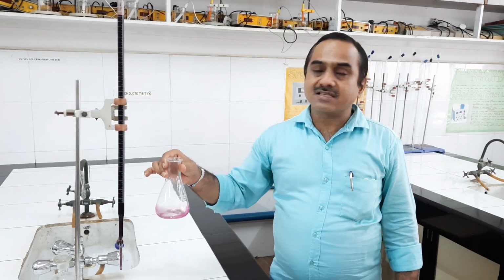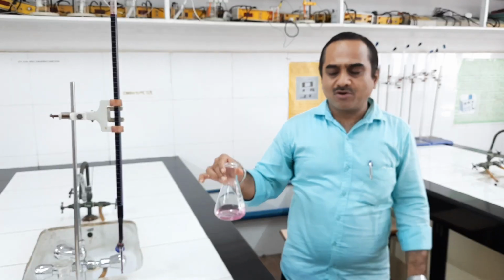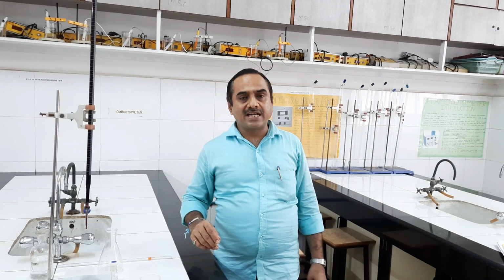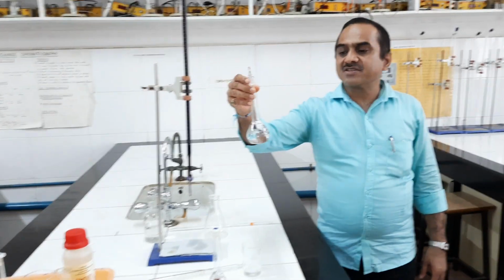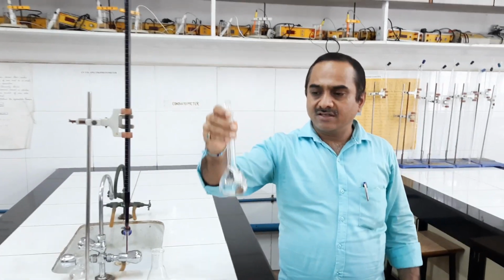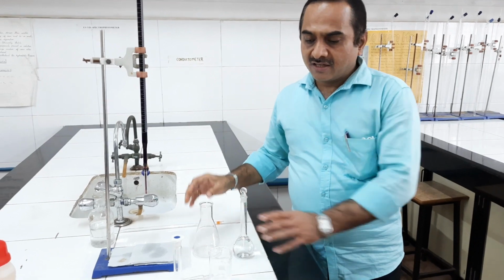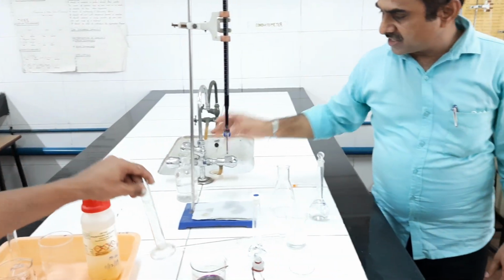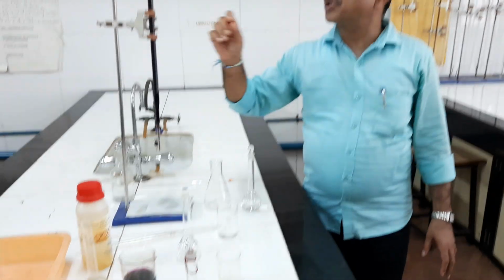We have to take 3 readings, and after taking 3 readings we have to report the constant burette reading for standardization. Now the second part of the procedure, that is the main titration, the estimation part. The unknown persulphate solution is diluted up to the mark. From this solution we have to pipette out 10 ml into a conical flask. Then we need to add 3 ml phosphoric acid, 5 ml sulfuric acid, exactly 25 ml of 0.1 N Fe2+ solution, and then we have to titrate that solution against KMnO4.